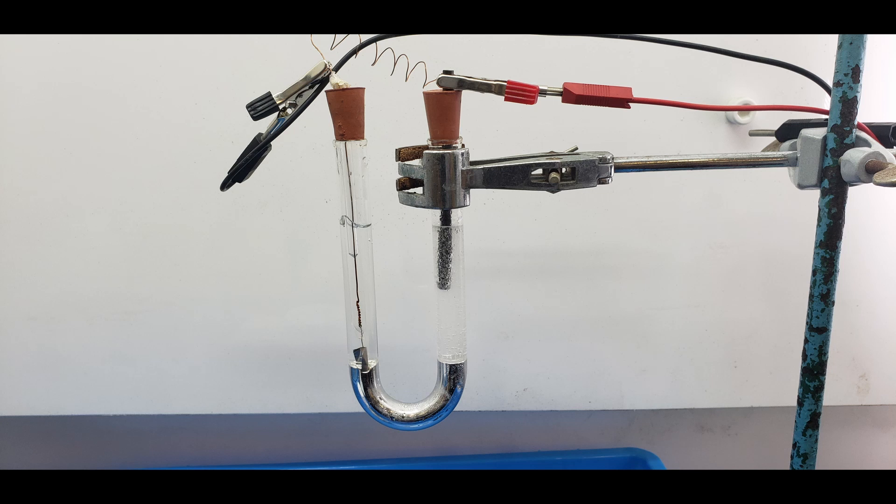Today I am going to perform an experiment of electrolysis of concentrated sodium chloride solution using mercury cathode.